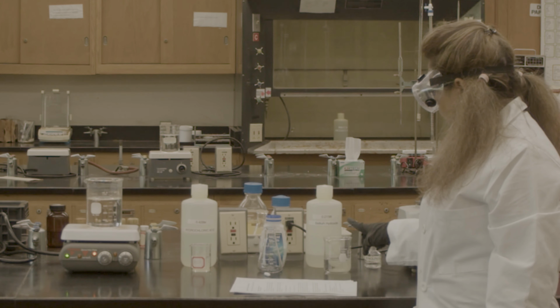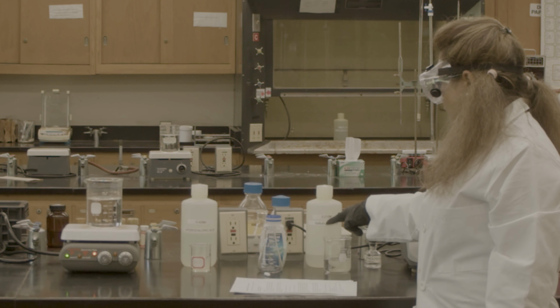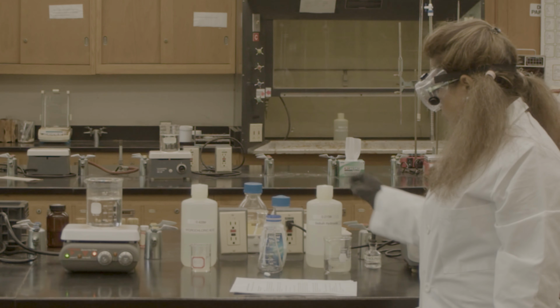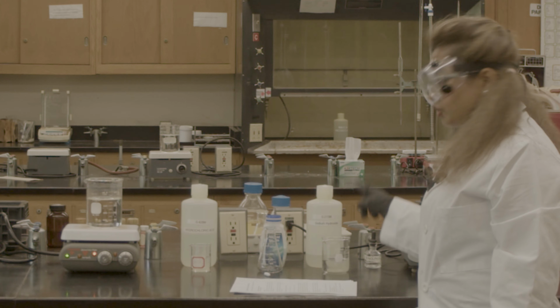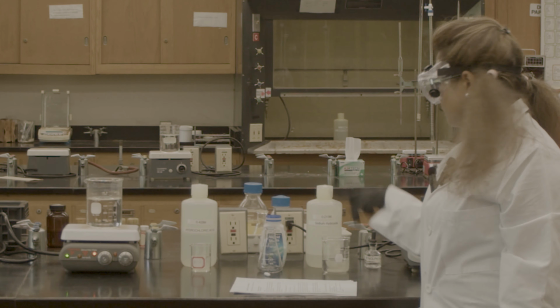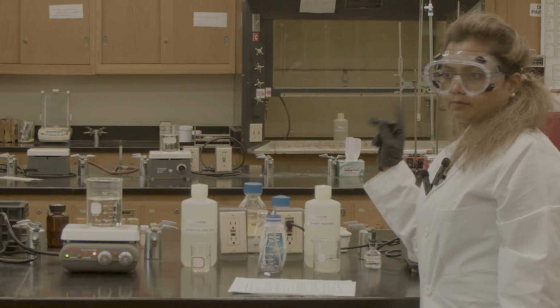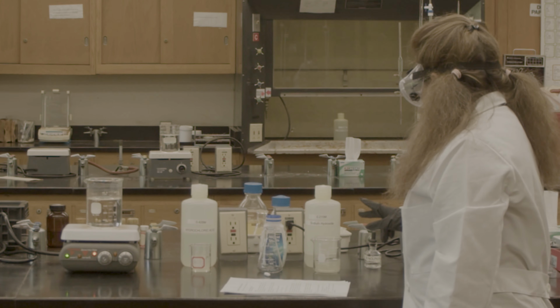Then we need the sodium hydroxide, 0.215 molarity. You can see it on the bottle. We are going to use a 50 milliliter burette, so I took about 60 milliliter, because I need some excess to rinse my burette too. That's all.